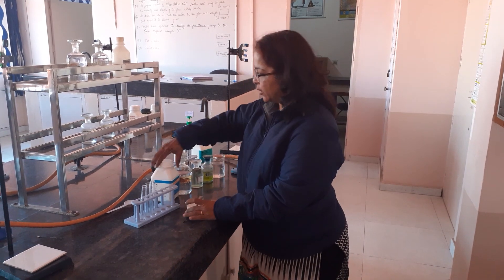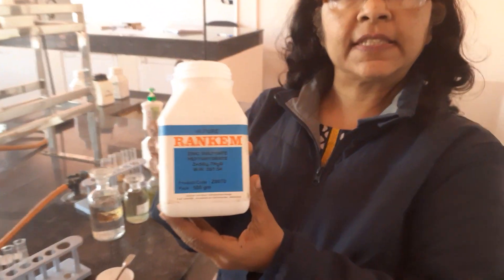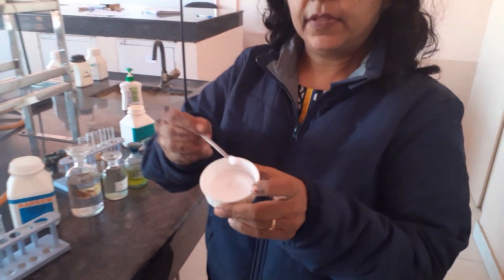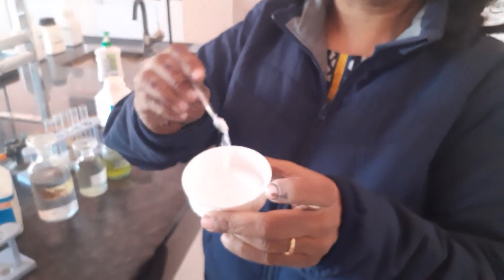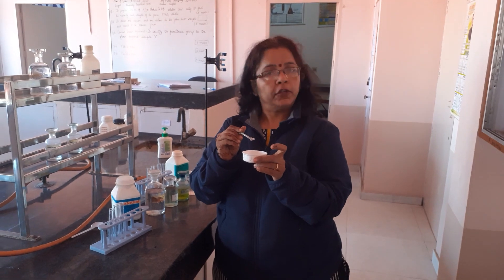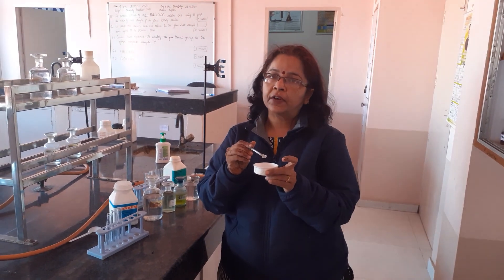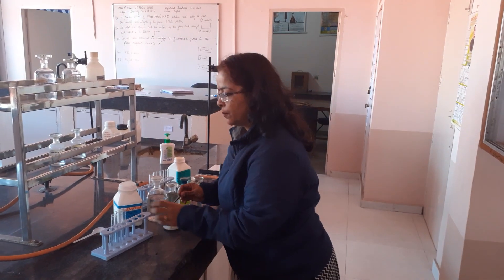I have taken a zinc sulfate salt. This salt looks white — have a look at it. This is a white colored, crystalline salt. Zinc has got 3D10, so there is no partial filled d-orbital. In the Zn²⁺ ion also it has 3D10, so it is a white colored salt.